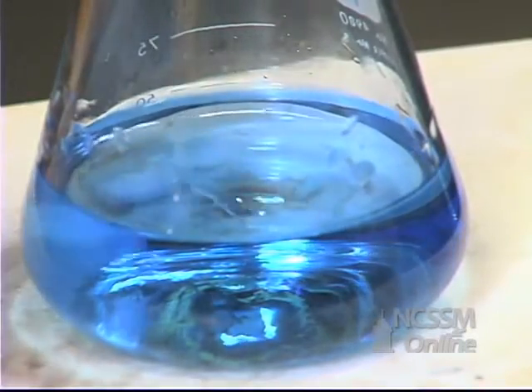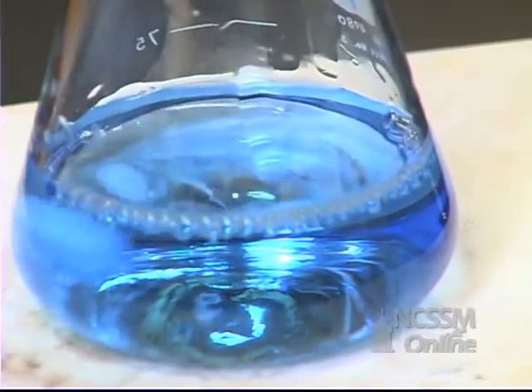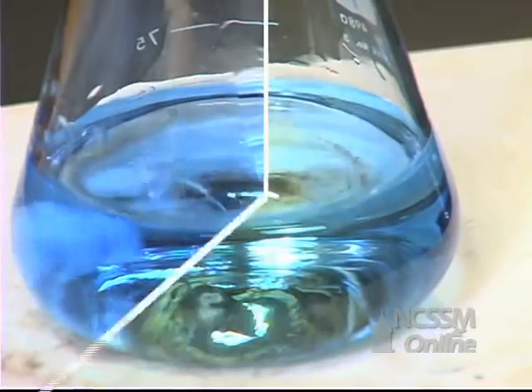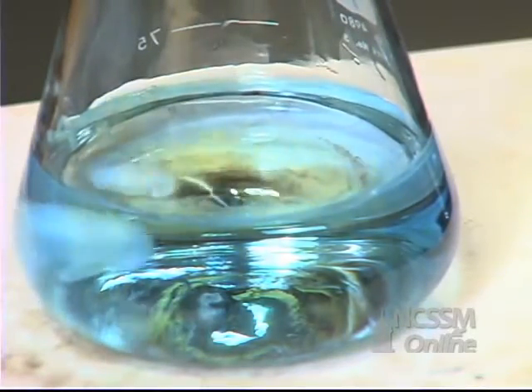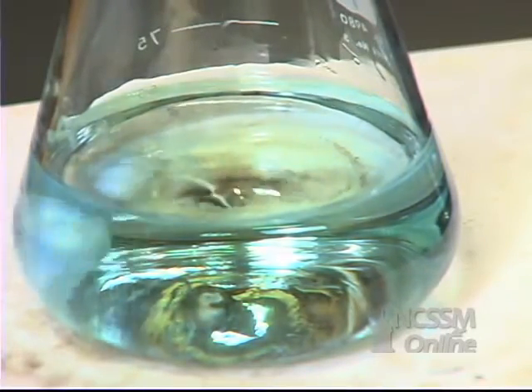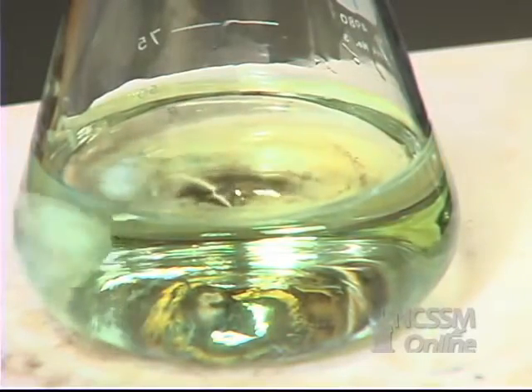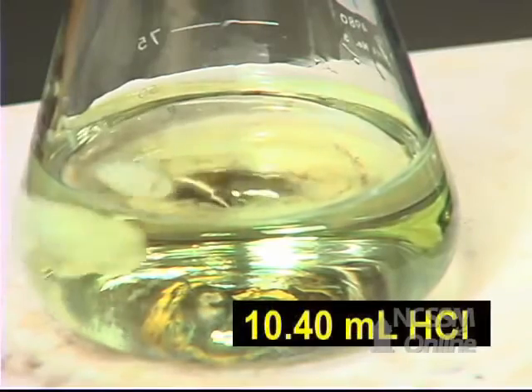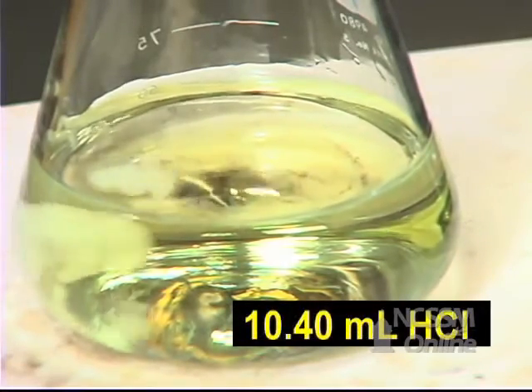We'll rinse down the walls of the flask to make sure everything gets a chance to react. We've now reached the pale yellow endpoint. We'll take a final burette reading.